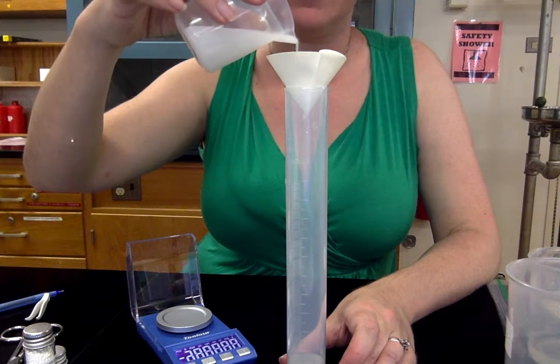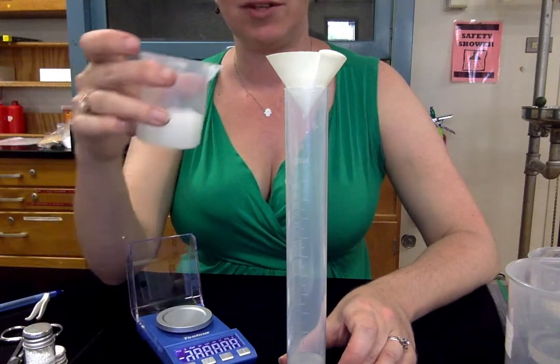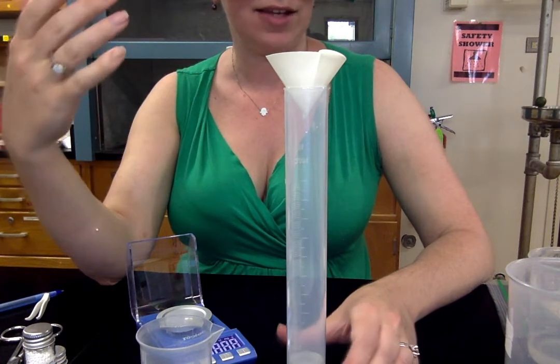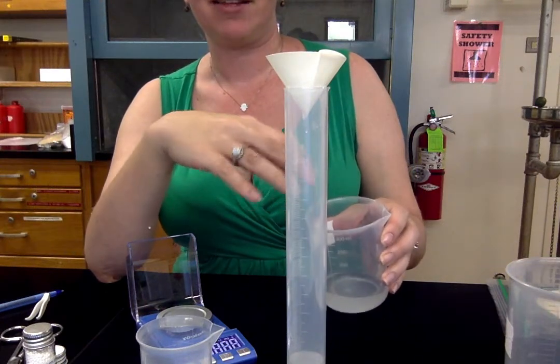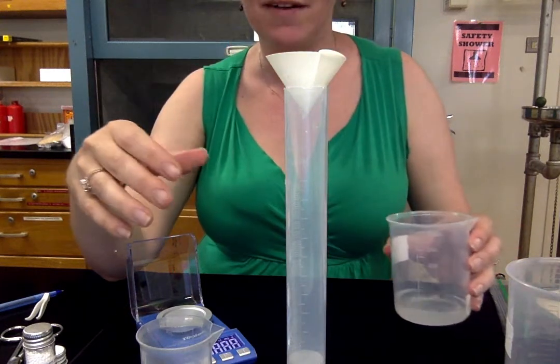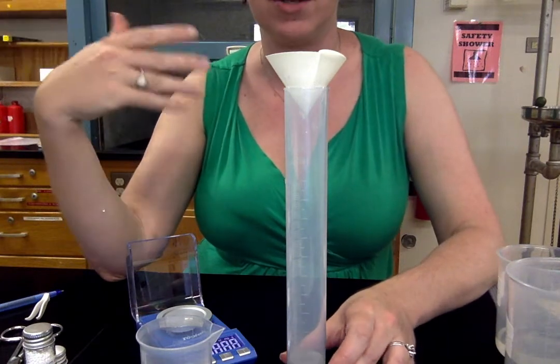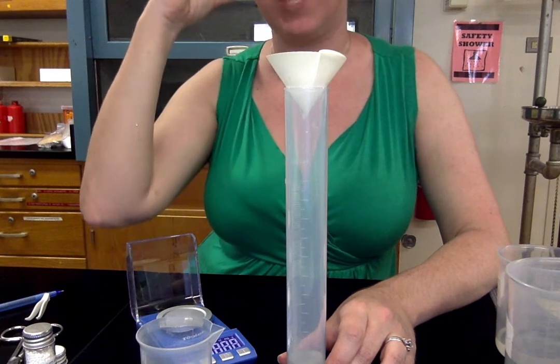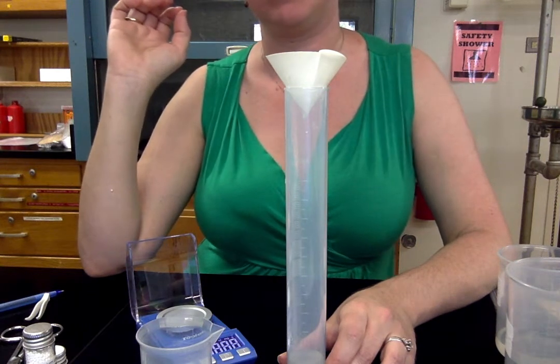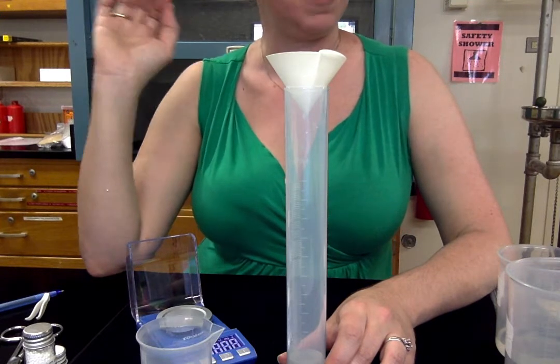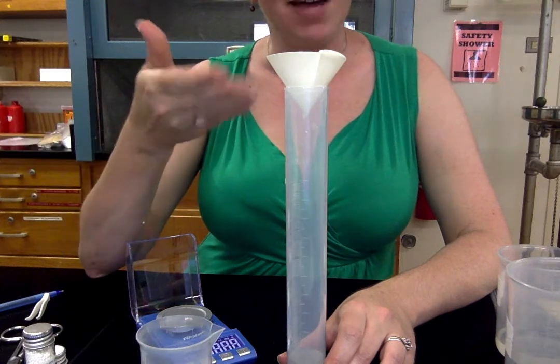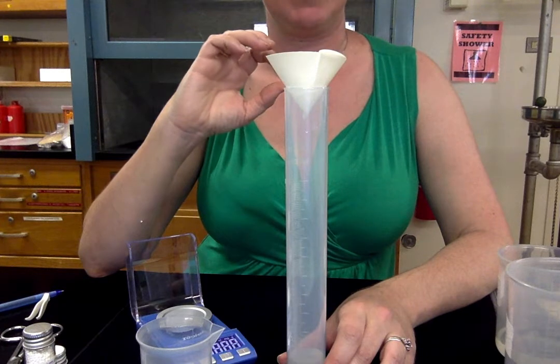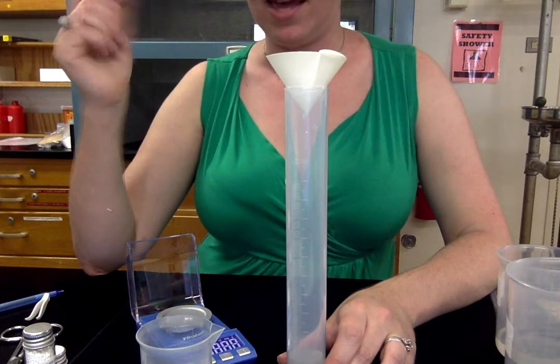So this is going to take a while. You might be sitting here for about 20 or 30 minutes just getting the filtrate through. And then you're just going to want to set that filter paper. So you can set aside like this. In the lab, I suggested that you use one of your beakers and you shove like a paper towel in it and make like a little pillow for it to sit on. You want to just make sure you put it somewhere that's out of the way so that no one in your house accidentally knocks it over or throws it away. So just put it somewhere where it's not going to get ruined. I think sometimes inside a cabinet in a house. My house, we have people, we have kids, we have animals. So the safest place to put it would be in a cabinet that closes that the animals cannot open and the kids will not want to open. Warmer places will make it dry faster than colder places.